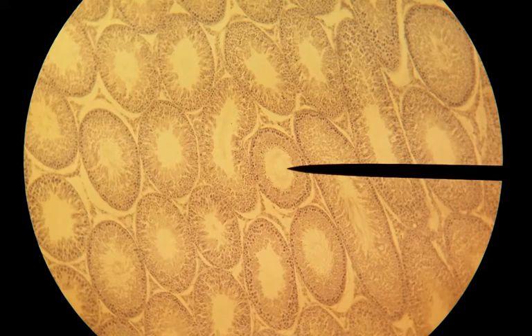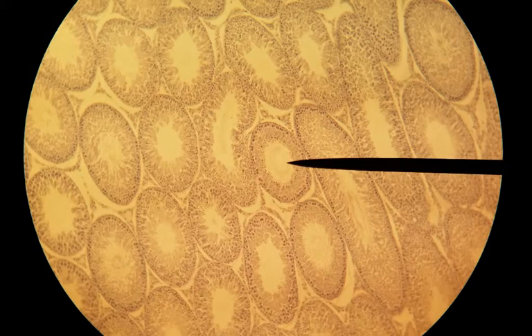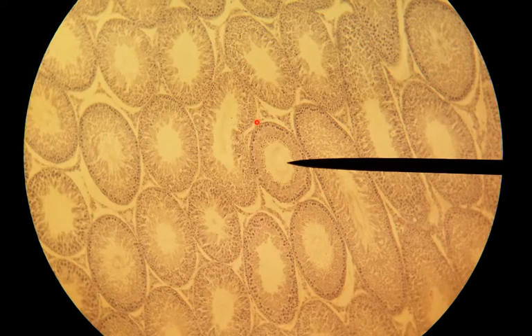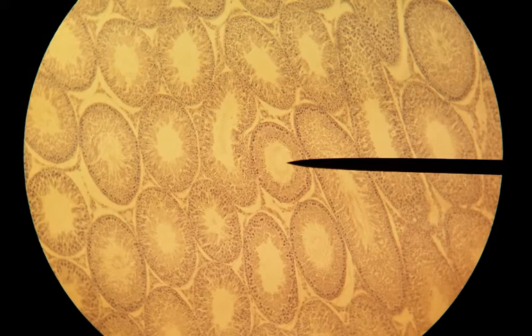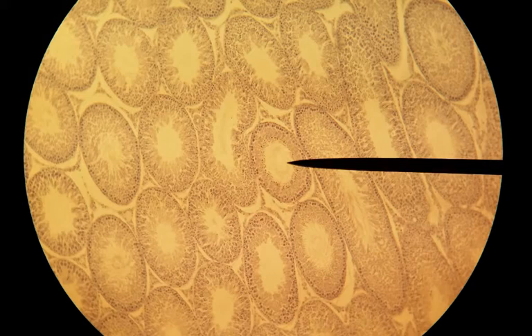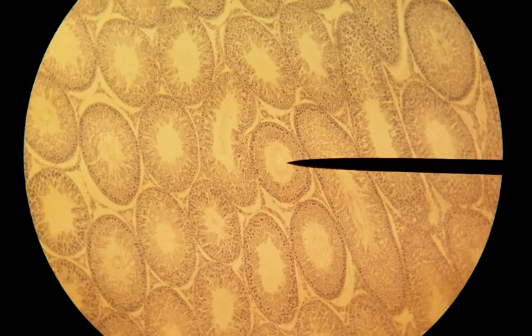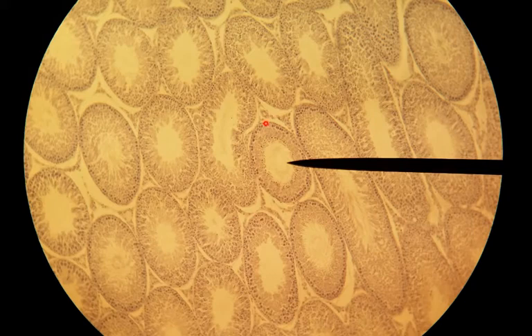This first slide that we're looking at is the testis slide. A lot of people don't realize what they're looking at when they see this slide. We've got all these circular structures, which are seminiferous tubules. If you can imagine something like a garden hose — just a long tube wadded up — that's essentially what each testis is. If we took that tube and cut it in cross-section, everywhere we sliced it we would see these oval or round structures, and that's exactly what we're looking at on this slide.